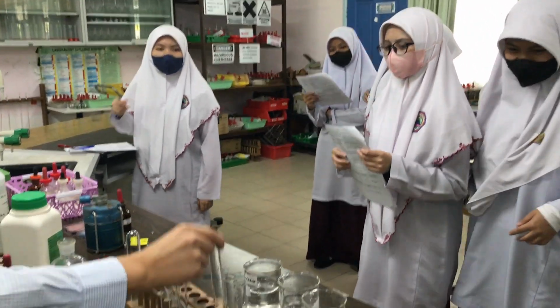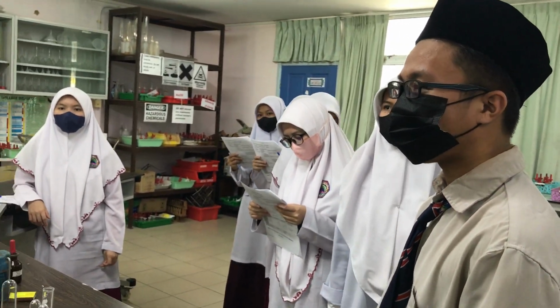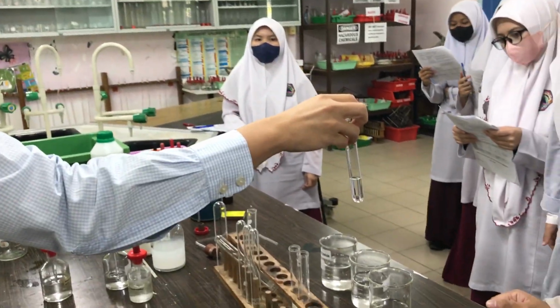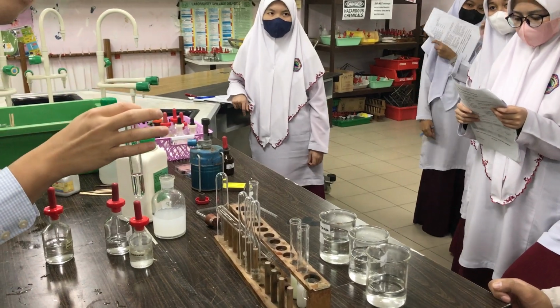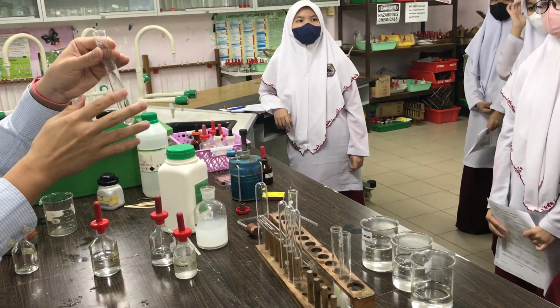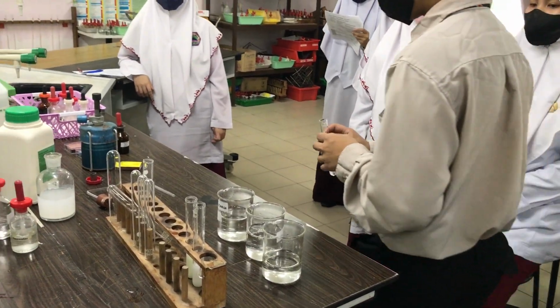So I already added, what was the first thing I added just now? No, you are going to add silver nitrate, but before that I already added something. What was it I added already? Test for chloride, bromide, iodide. I already added something just now. What did I add? No, iodide is what I want to test for. What did I add just now? Nitric acid. I added nitric acid. Come on, add the silver nitrate now.